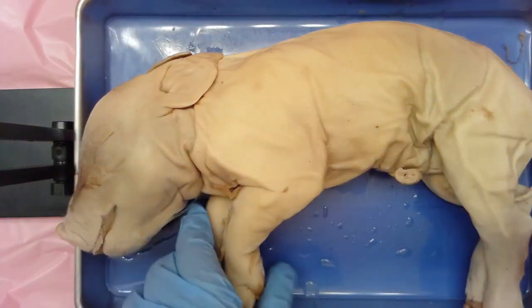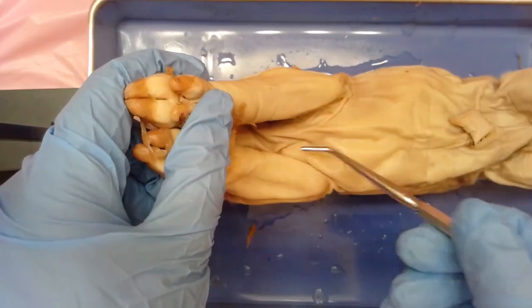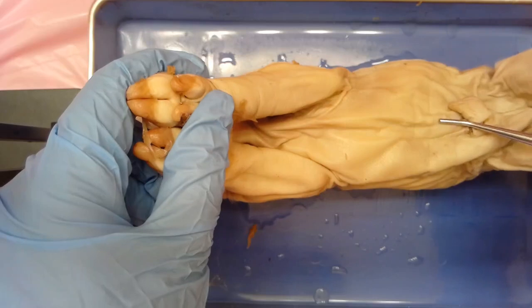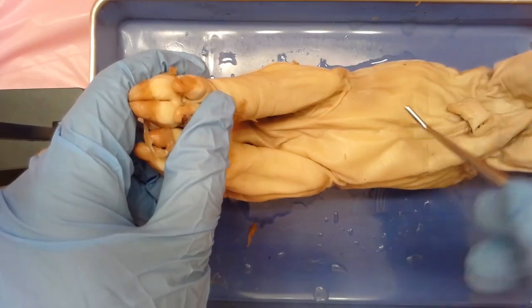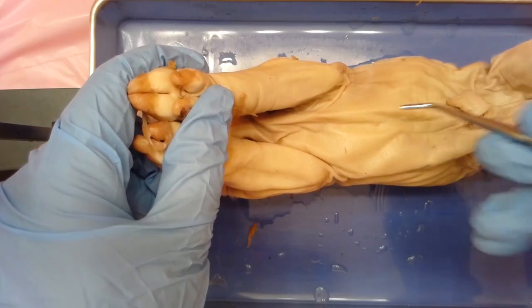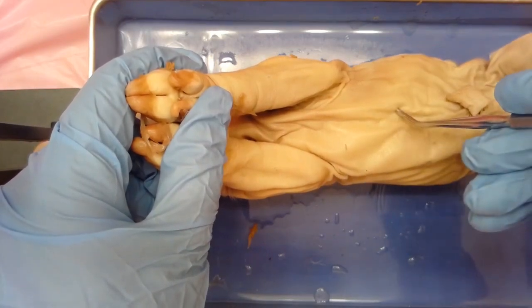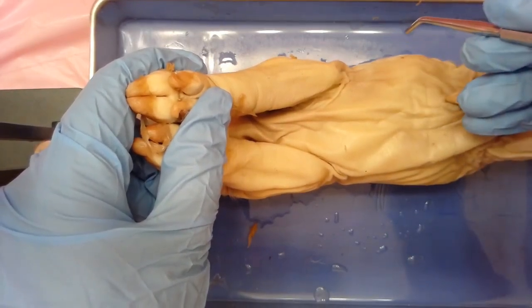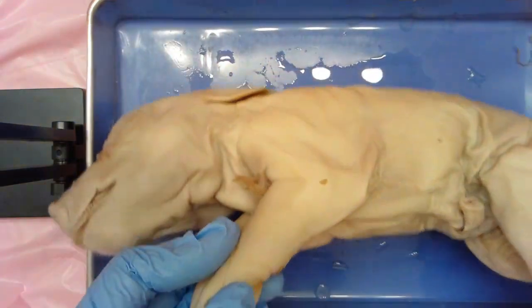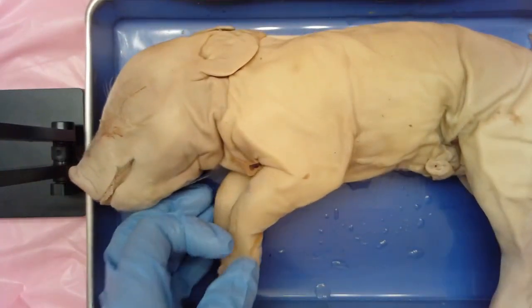We can also describe some terms used in reference to the midline of the animal. If I were to lay it on its back and look at an imaginary midline going down the center of the body dividing it in half — going towards the outer part of the animal is what we refer to as lateral, going towards the sides. Moving inward toward that invisible midline is referred to as medial, going towards the middle. Those directional terms will help us as we start identifying where certain structures are in reference to other anatomical structures.